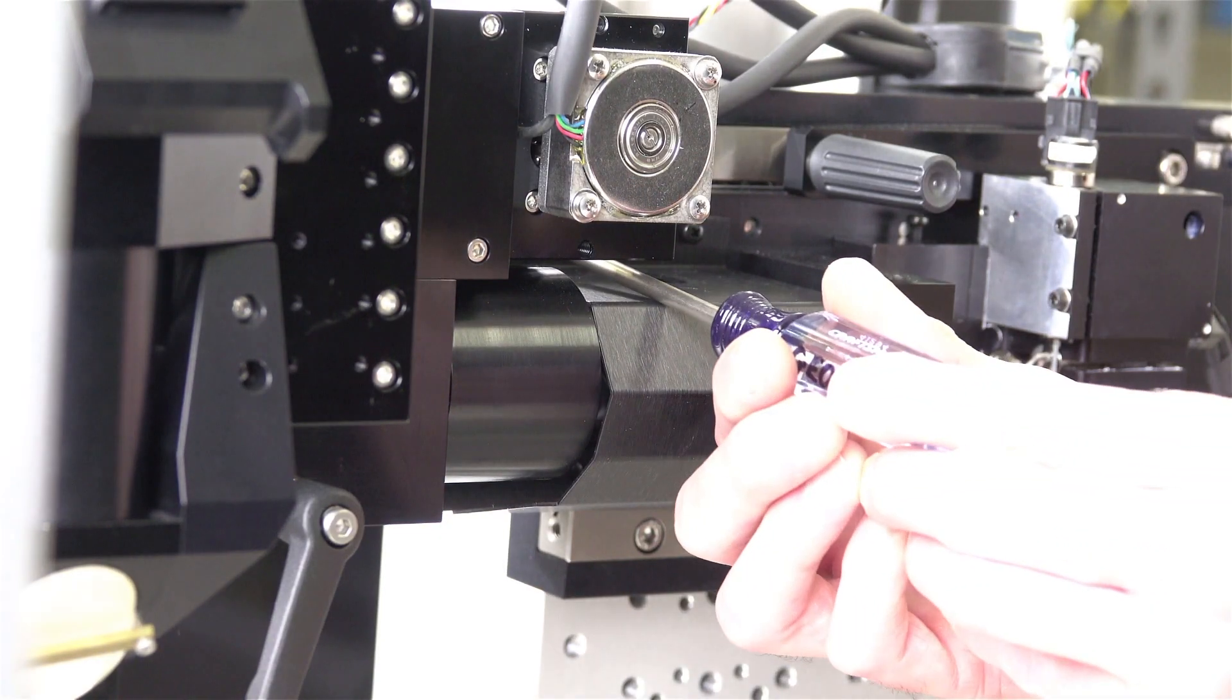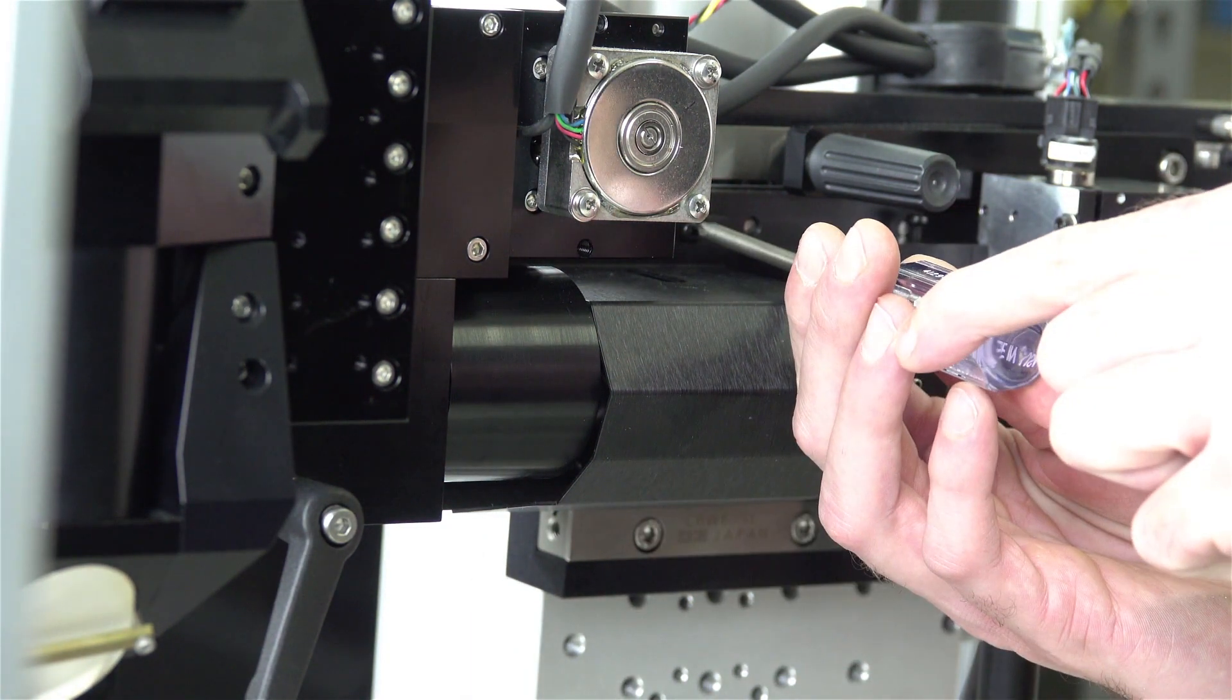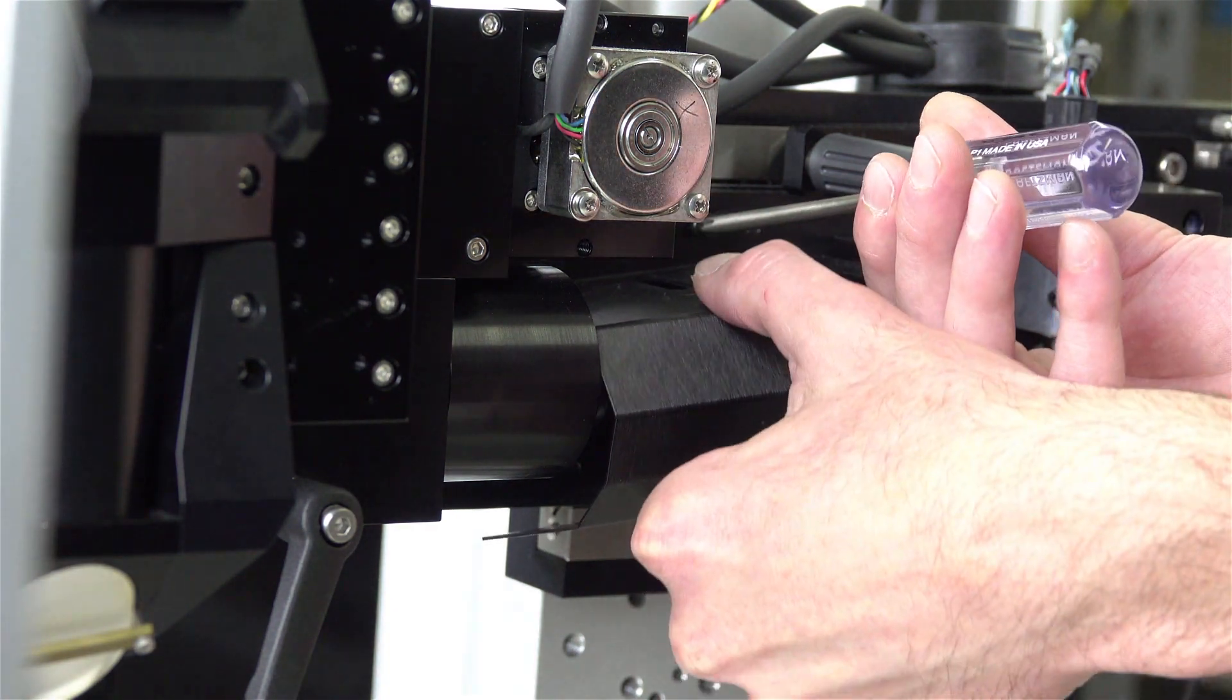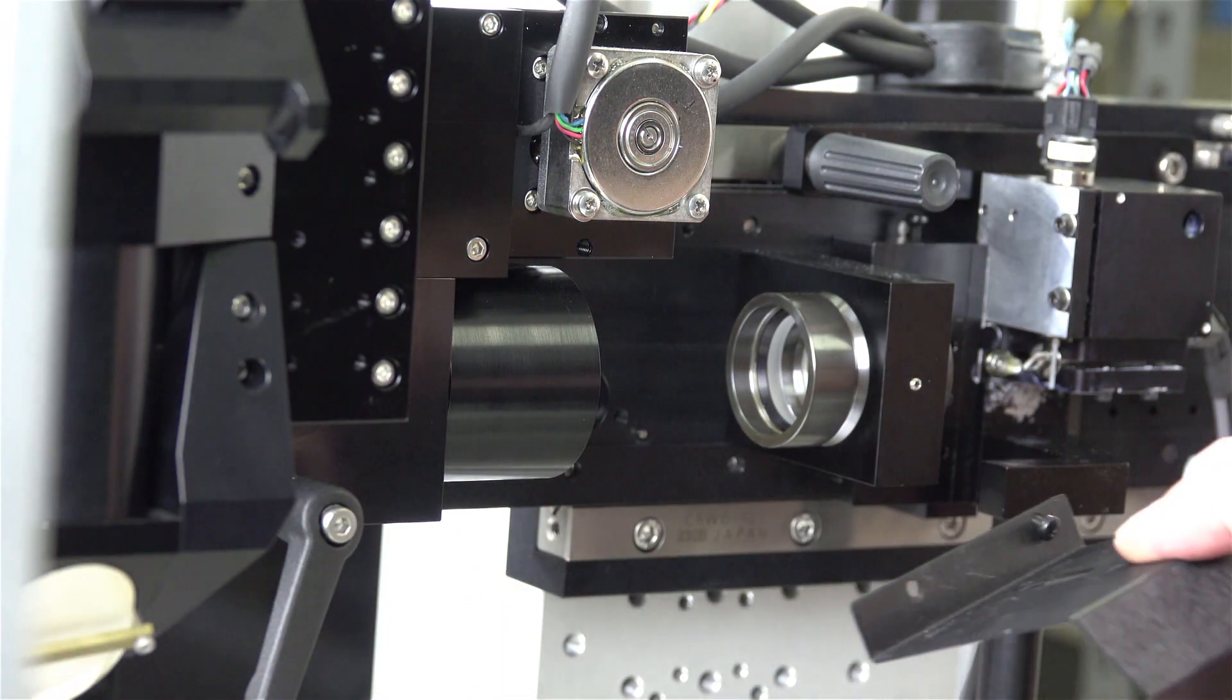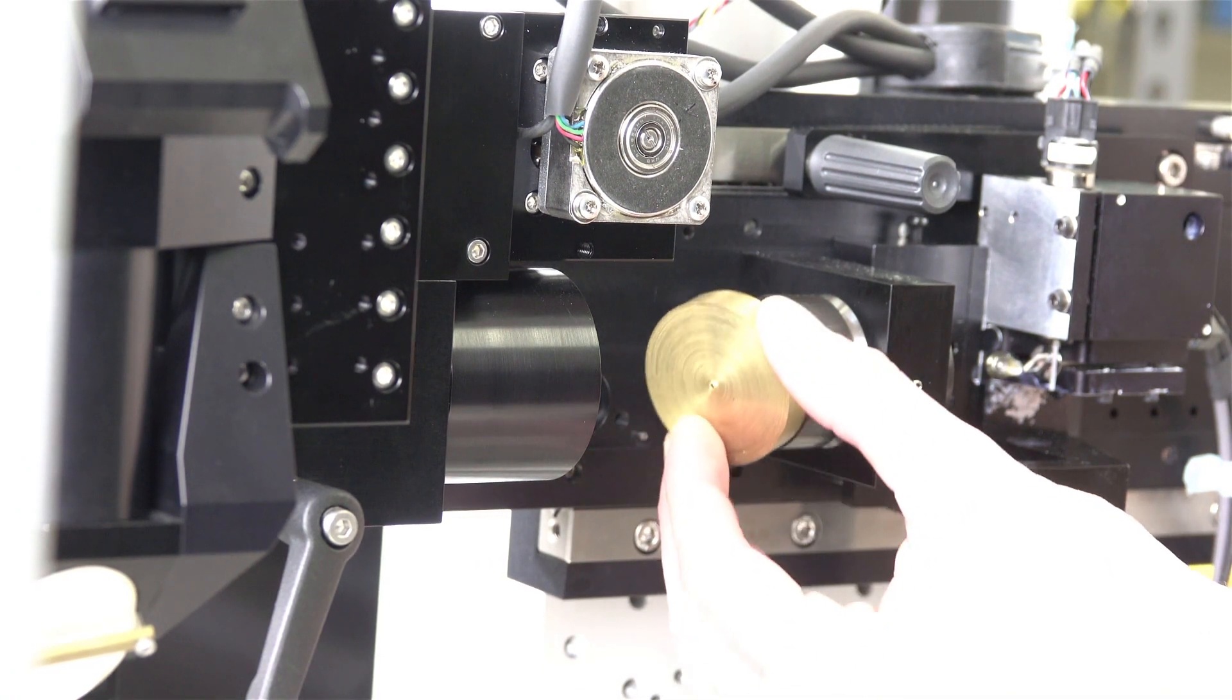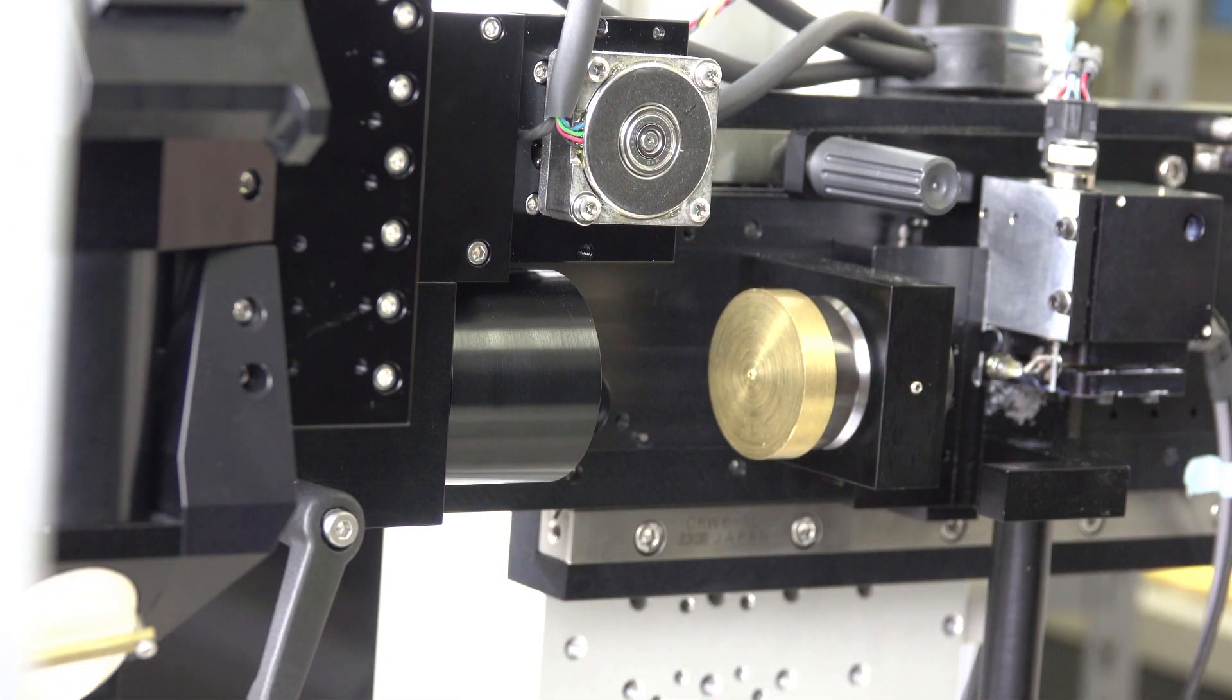Step 3: Very carefully remove the scan lens cover, and slide the unthreaded scan lens pinhole over the front of the scan lens. Now both pinholes are in place, which will be used to align the alignment beam through the center of the optical path.